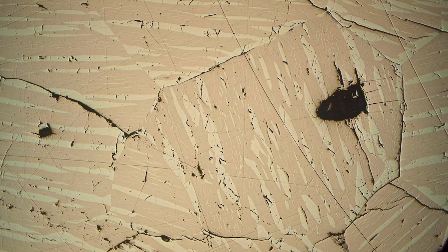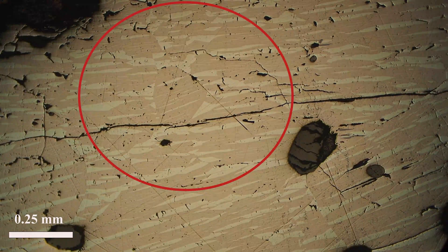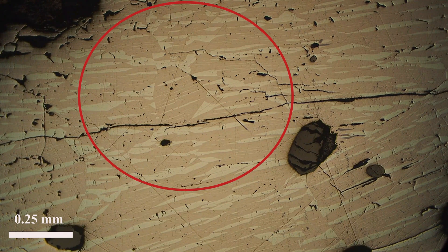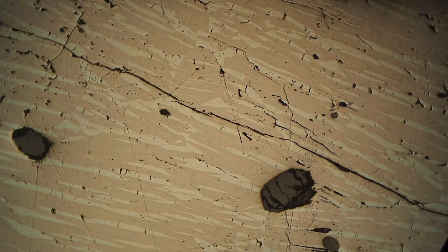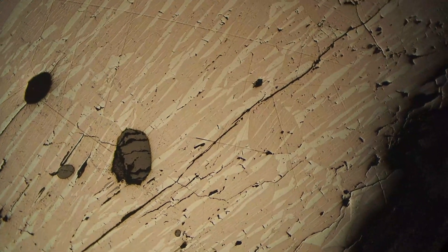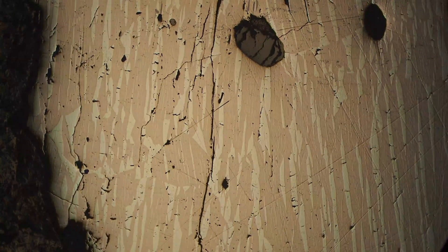We're going to go to a different section now, just to see this again. As we rotate the stage in plain polarized light you can see it's getting darker and then lighter as we rotate the stage — and that's the bireflectance of ilmenite.